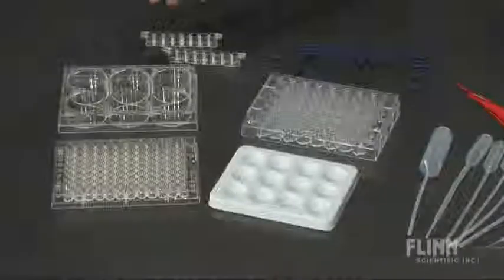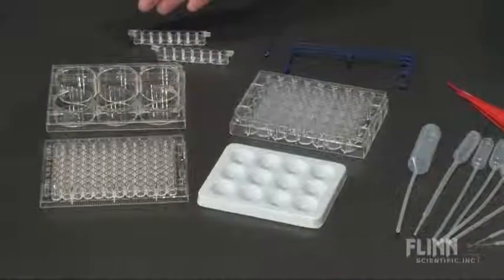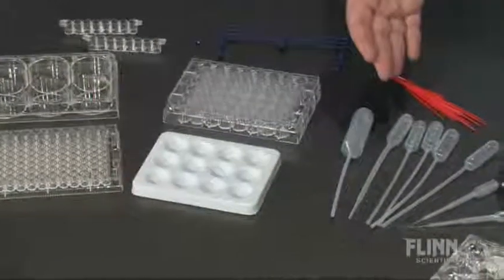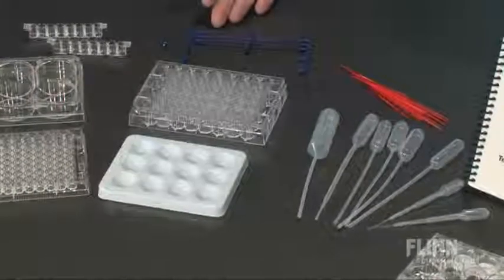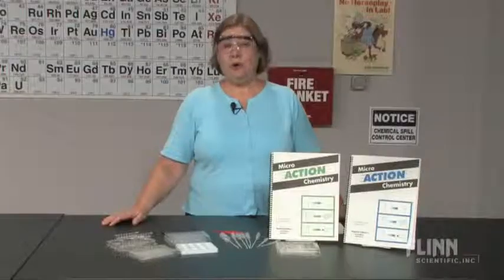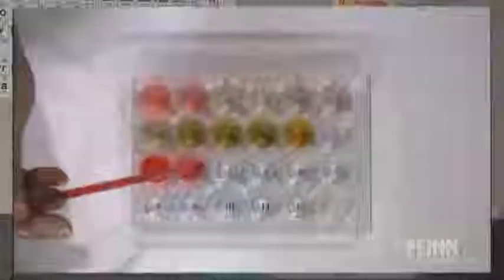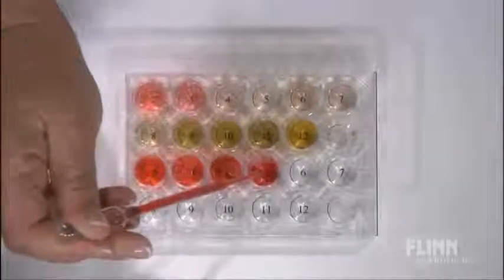Instead of using flasks, beakers, and burets, you use micro well plates, reaction strips, plastic pipettes, even mini stirs and mini spatulas with microscale quantities of chemicals.